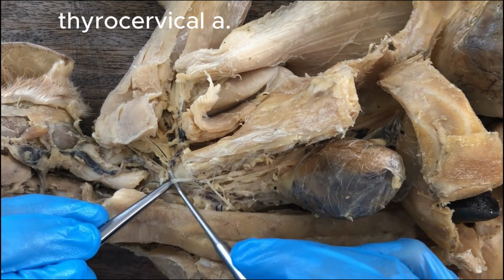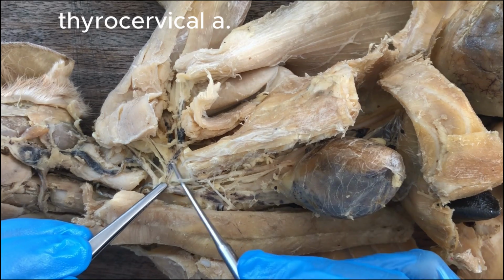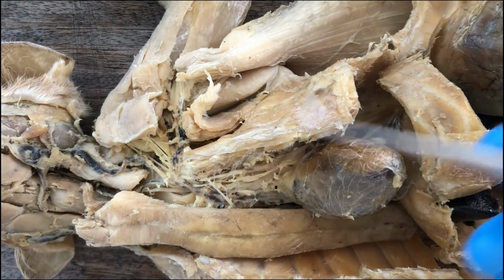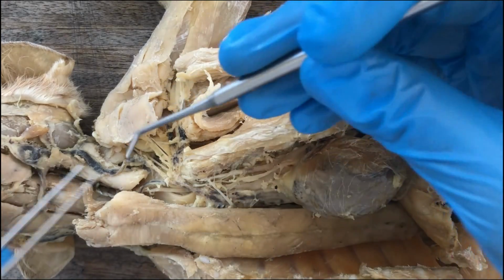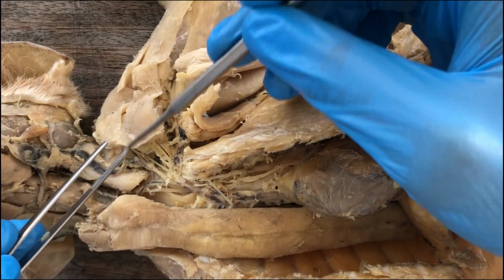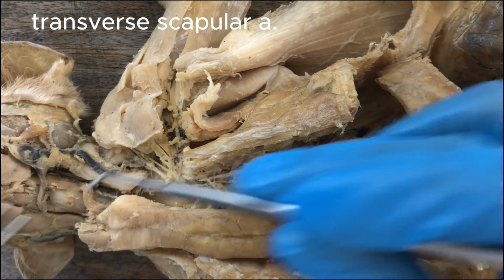That's a transverse, no, not yet the transverse, but the thyrocervical artery. So you see, it's named thyrocervical because it will eventually split. One of its branches will go to the shoulders as the transverse scapular artery, and the other one will go to the thyroid gland, right?